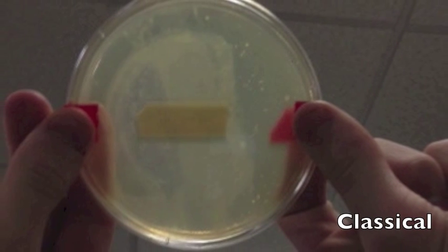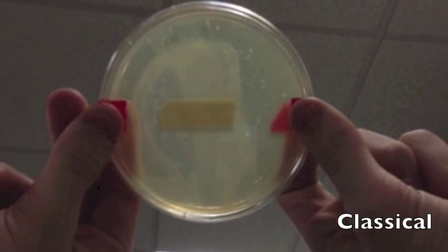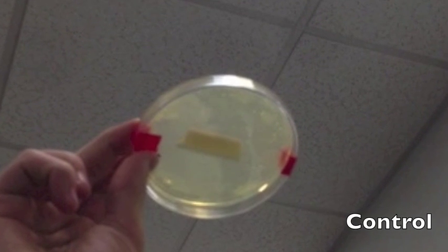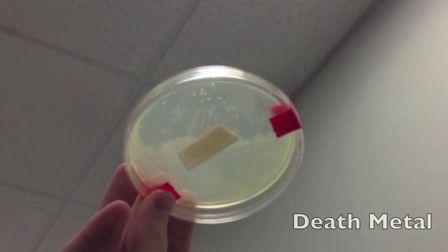These are the three final petri dishes: Classical, Control, and Death Metal.